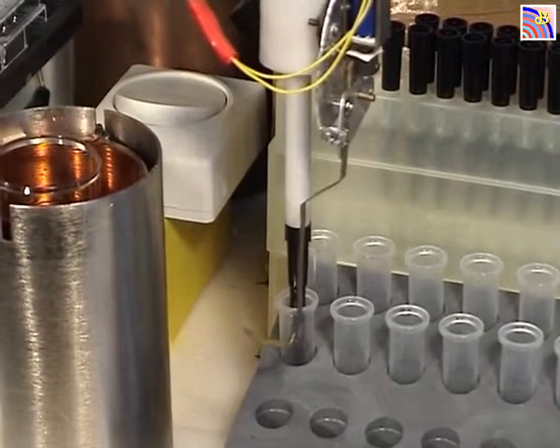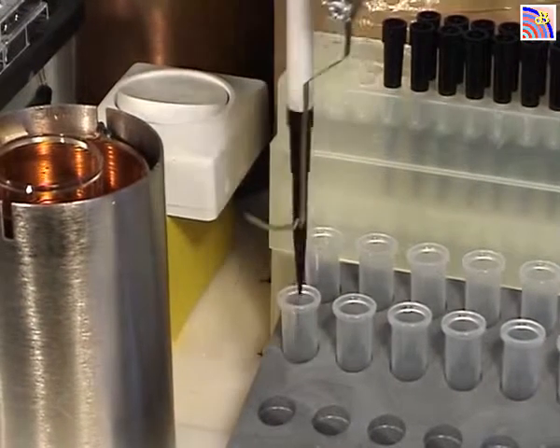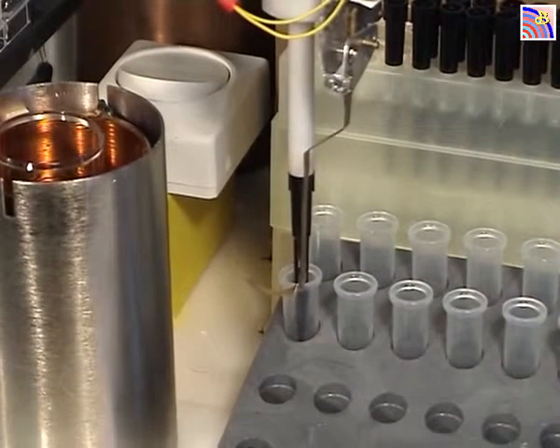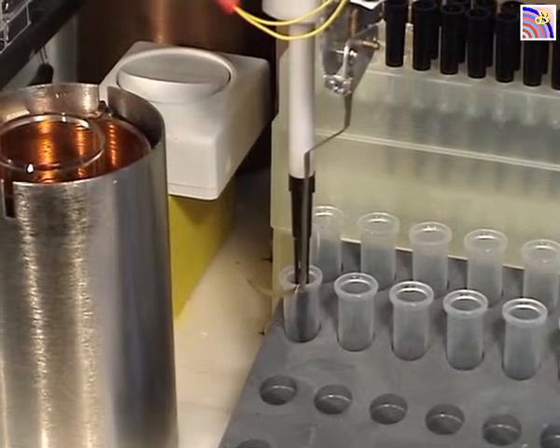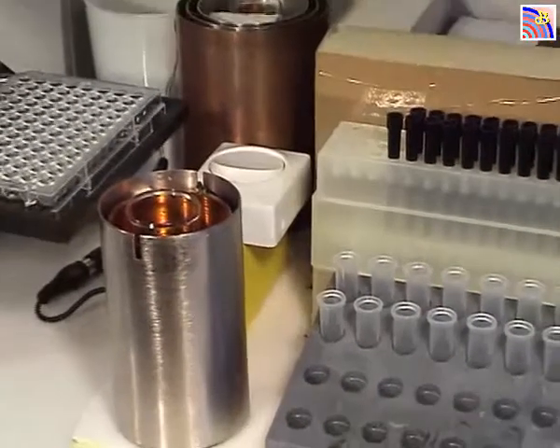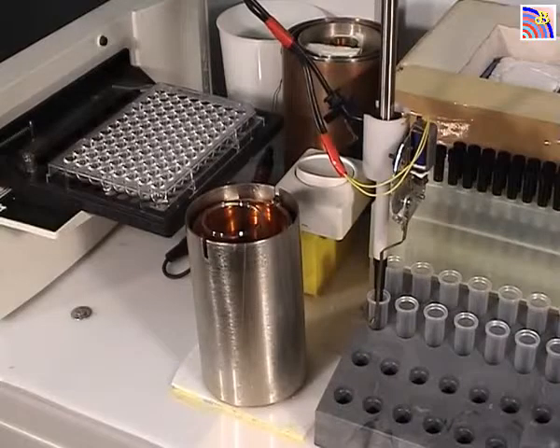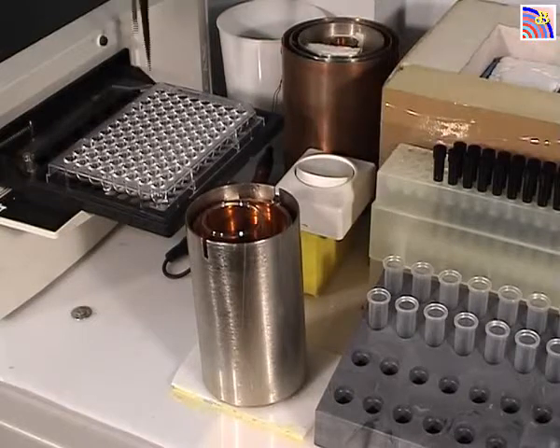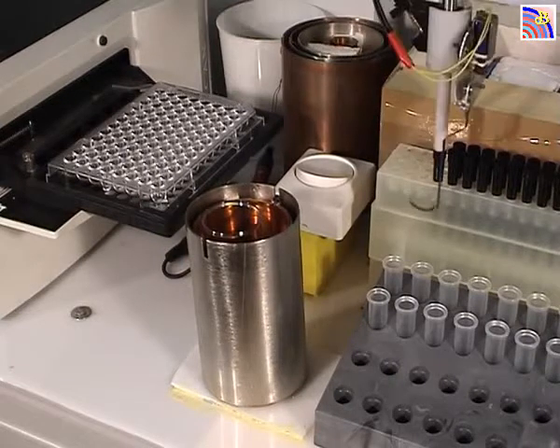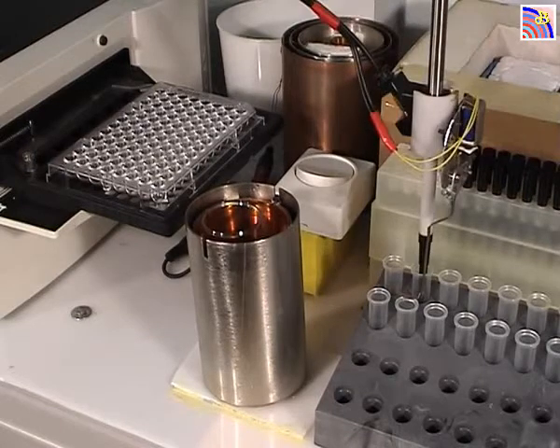The first tube is now well mixed. We will now dispense the content of this mixed first tube into 2 wells. Then we'll see the 96-well plate, which is waiting on the plate of the spectrophotometer.